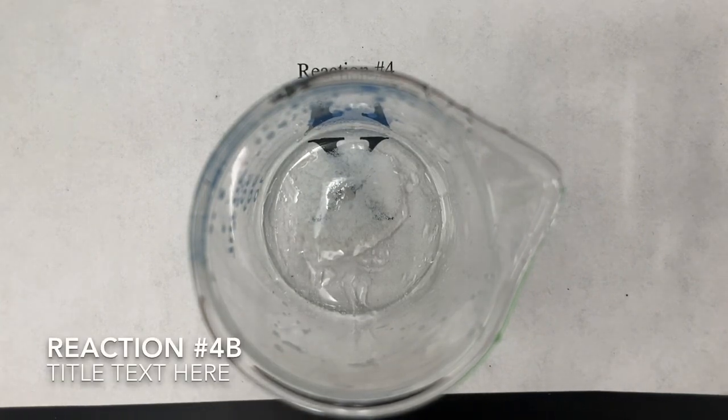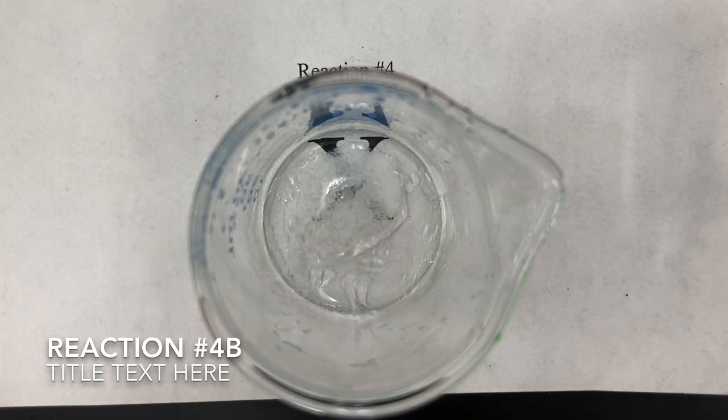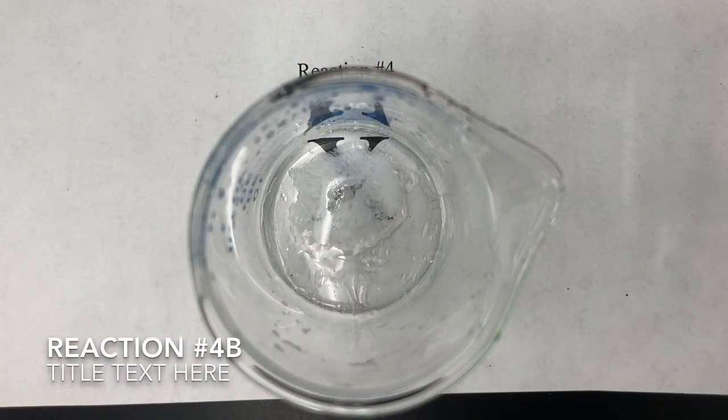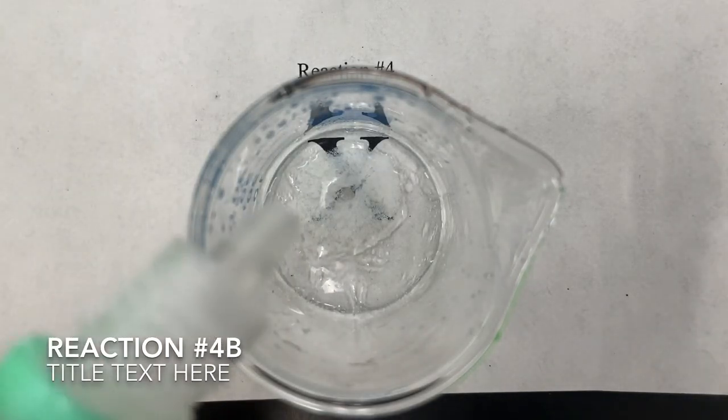All right, for the very last change here, we're going to add some nitric acid, HNO3, which is going to react with the sodium hydroxide here. So when it reacts with the sodium hydroxide, it's actually taking away some of that sodium hydroxide. Which direction do you think equilibrium will shift if this nitric acid reacts with the sodium hydroxide? Okay, take a second to predict. Pause the video if you need to. All right, so let's go ahead and add some nitric acid and see which direction the equilibrium shifts here.